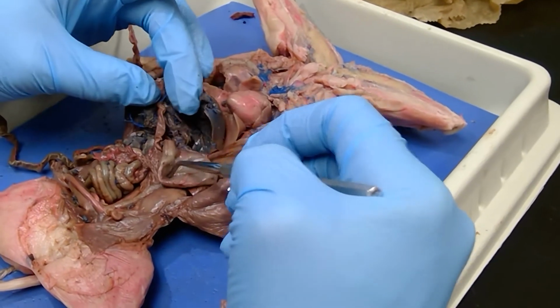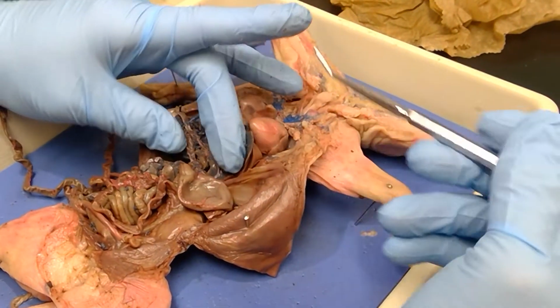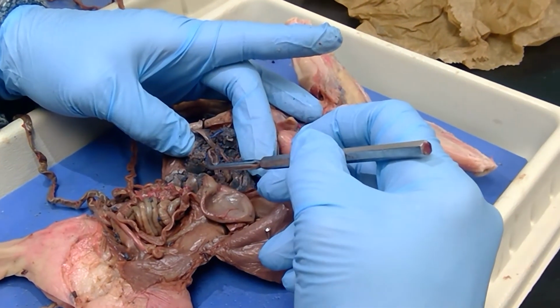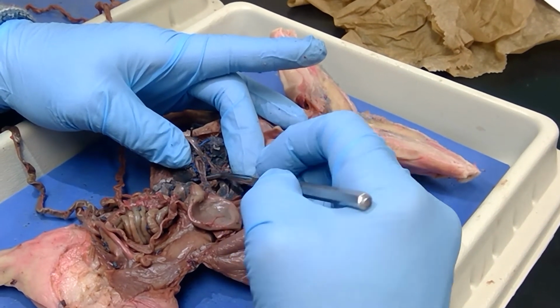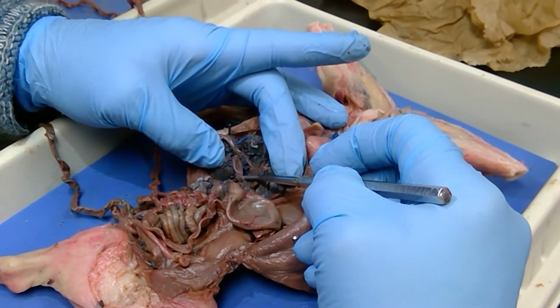Okay, we need to look at the gallbladder. So we need to lower the stomach, pull it down, and lift the liver up because the gallbladder is on the inferior surface. If you lift the liver up, we've got this little squishy area right here. And we're going to see it on the fresher pig better in just a second. But this right here is the gallbladder. The cystic duct is what's going to carry bile from the liver, or actually from the ducts, into the gallbladder. So this right here is the cystic duct.